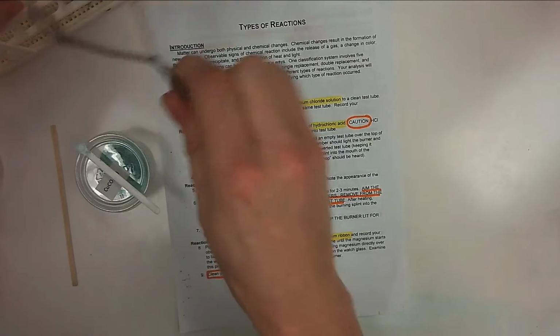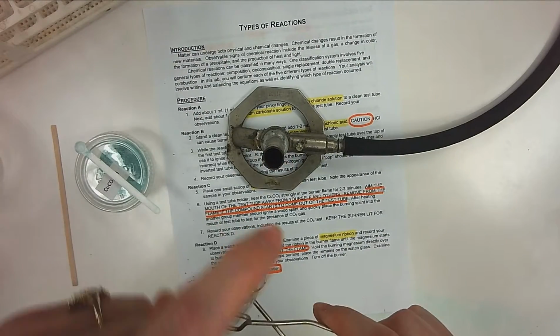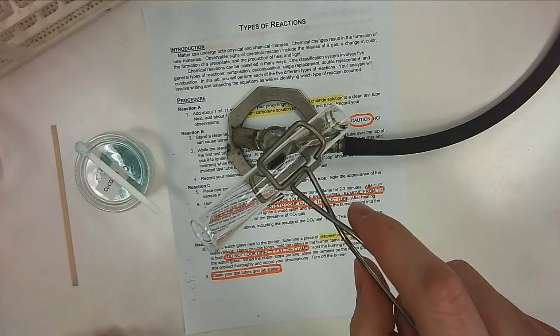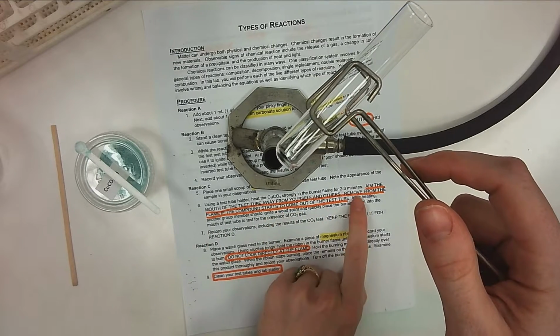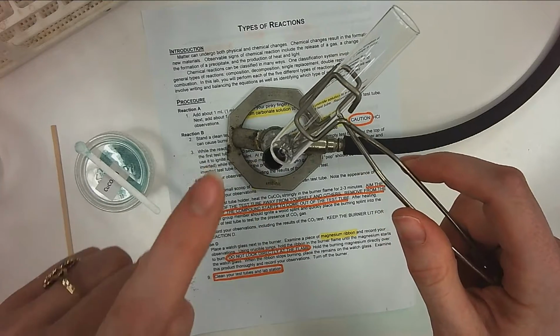Then what you're going to do, using your test tube holder, these are your test tube holders, you're going to grab it, place it over the Bunsen burner, and point the mouth of the test tube away from anyone. So make sure you're pointing this in a specific direction. Not only do you want to point it away from yourself and your lab partners, but every other student in the lab classroom. So you're going to hold it right near the flame. And you're going to remove it from the flame if any of this compound, that copper carbonate, starts to come out.